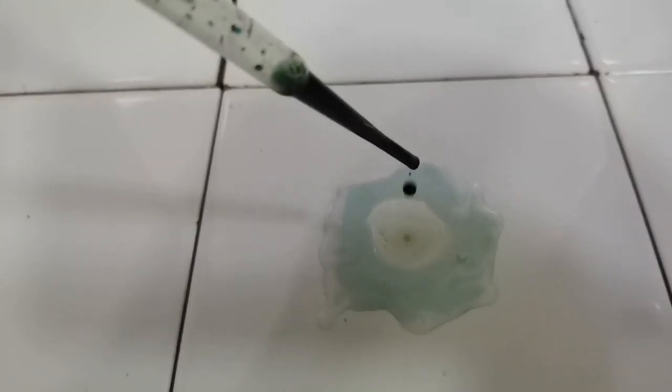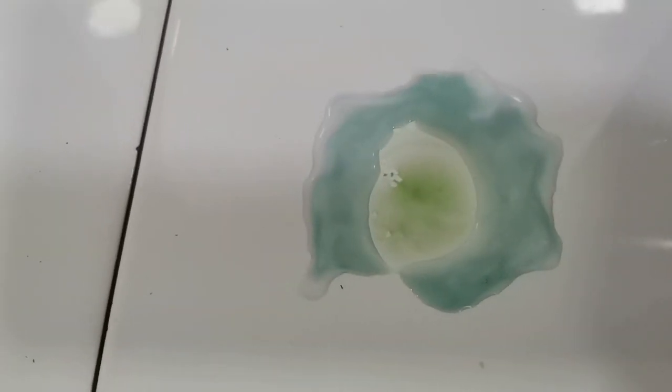So as you can see, my suspicion was correct. I had contaminated distilled water present. Here we can see a green color of the universal indicator in distilled water, and this is the actual color that we were supposed to obtain for a solution with a pH of 7. So this is the color in distilled water, not the one shown in the previous video, because that was contaminated with something, whatever the color was.